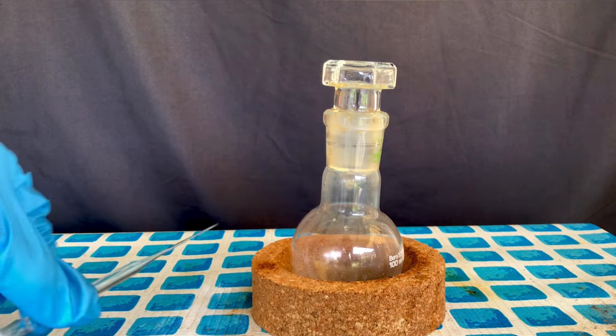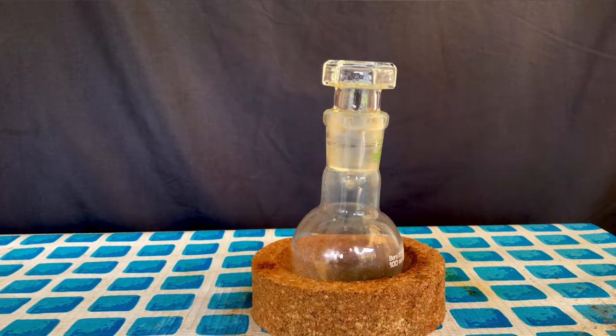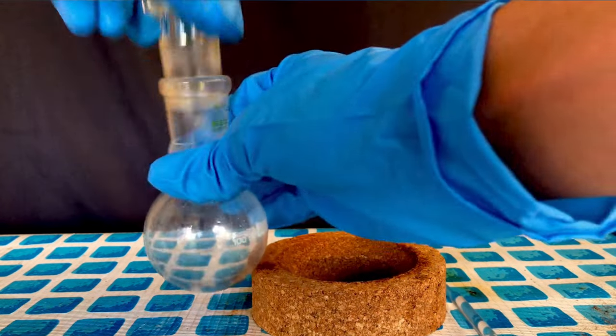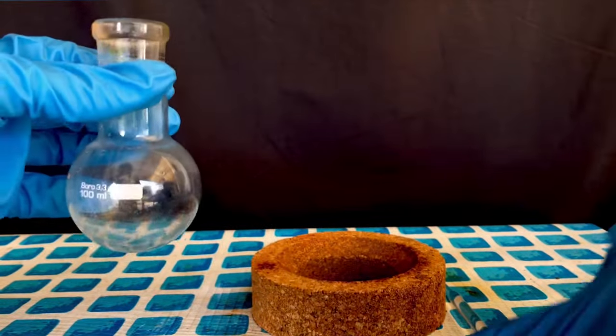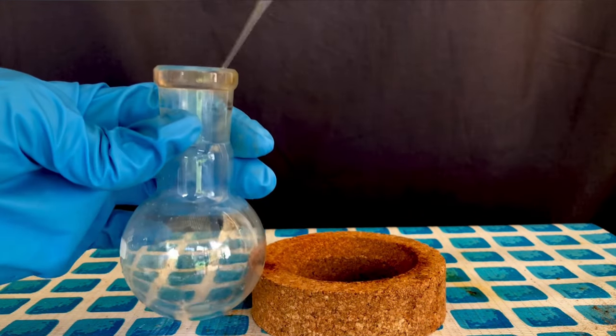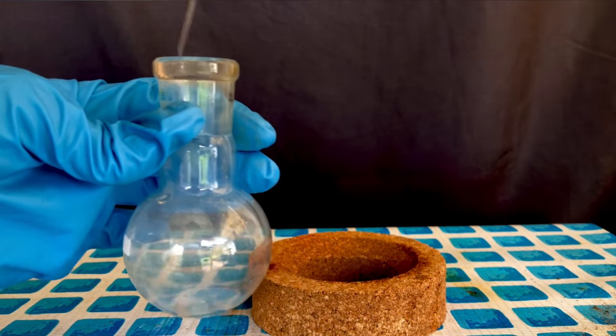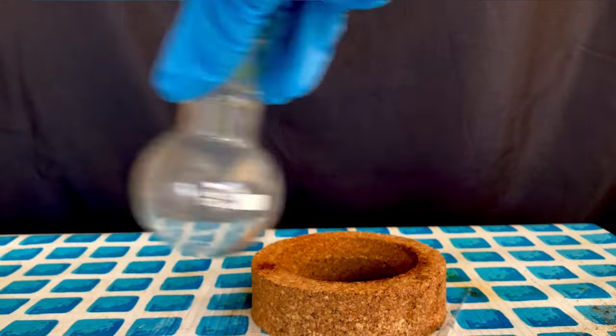It destroyed the rubber and thereby completely destroyed the PTFE-sealed bottle. A few drops of phosphorus tribromide were still left in the flask, so I decided to have some fun with them. Some distilled water was squirted in. I expected a violent reaction, but it didn't happen.